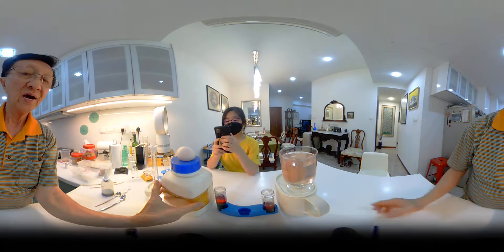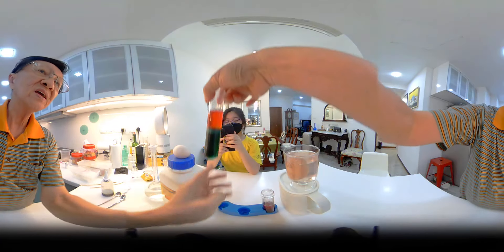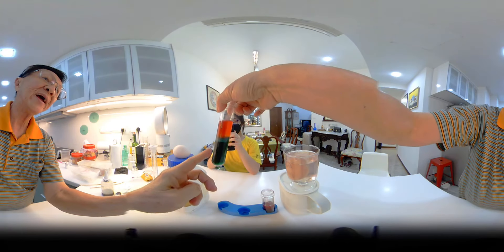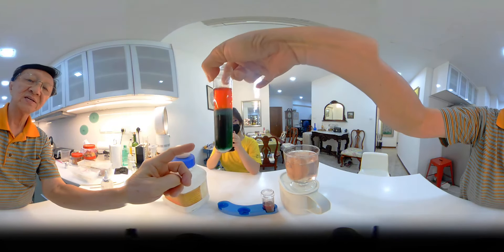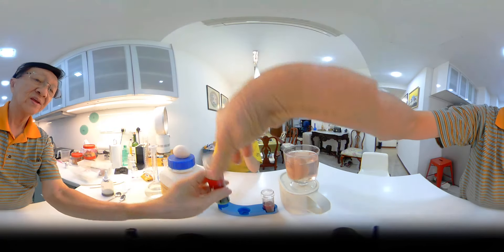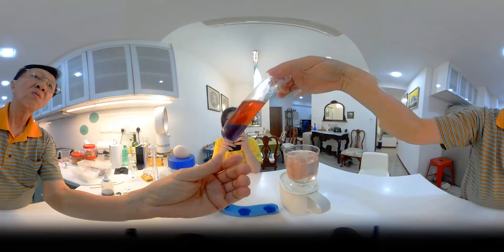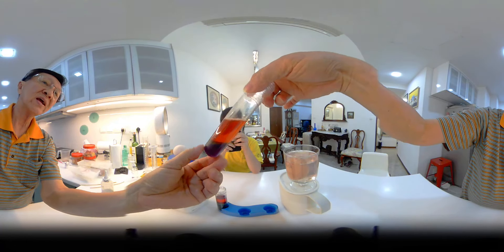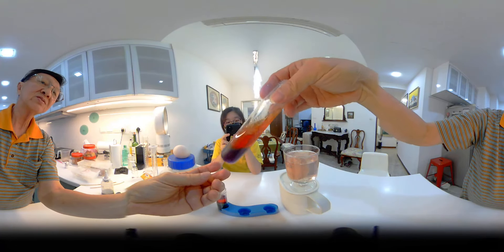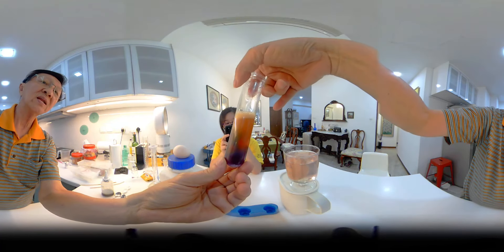Here, I have got strong alkaline with a weak acid, and there are only three colors: purple, green, and red. Here, I've got weak alkaline with a weak acid, and it's able to give you more colors, more color layers.